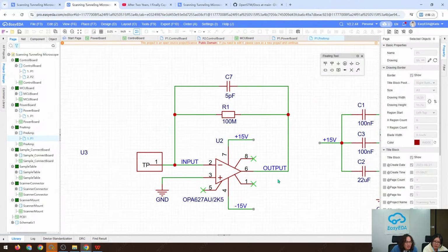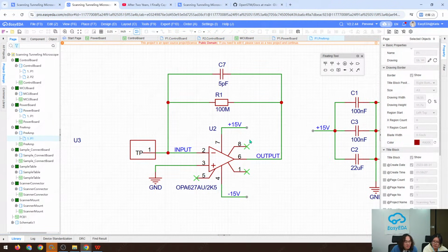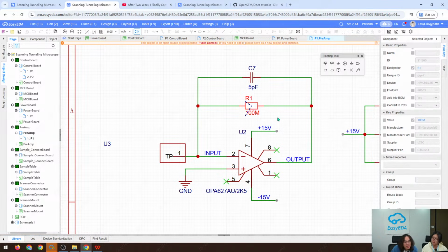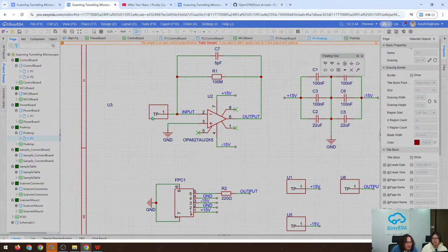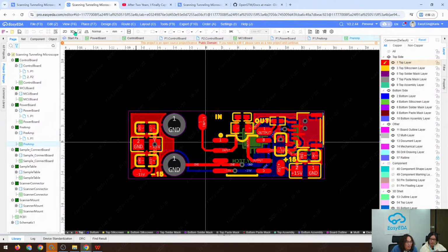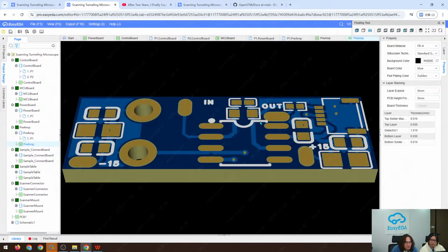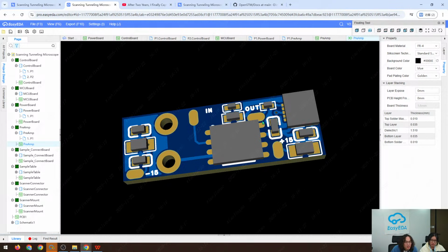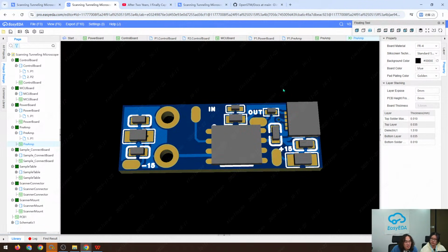The picture here shows just a simple TIA amplifier, and the feedback resistor is 100 megaohms, and yeah, it works. And this is the TIA board. Maybe we can click the 3D view for it. Here is our chip, and all the signal connection is via an FPC cable.